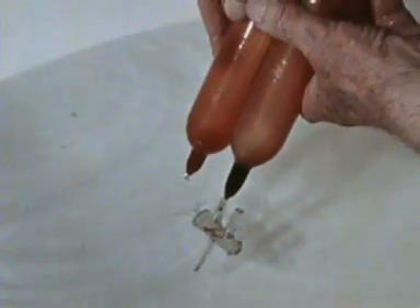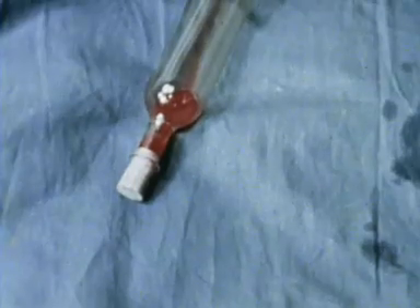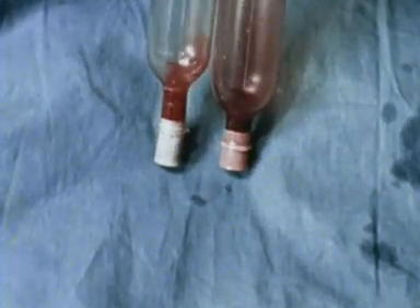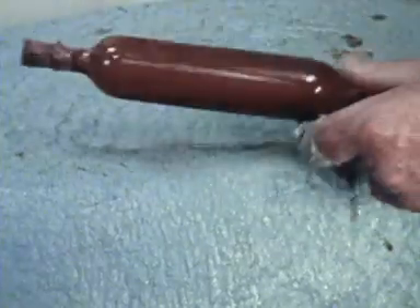But now it is a different story. At a higher temperature, the reference sample is still bright red, but the test sample has turned the dark red of venous blood. In other words, heat has driven off the oxygen by altering the shape of the dissociation curve.